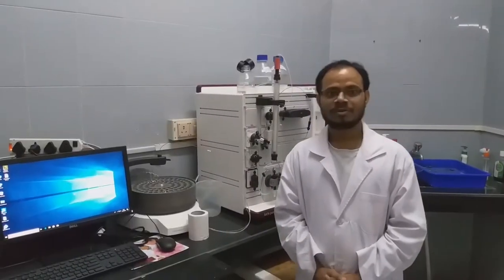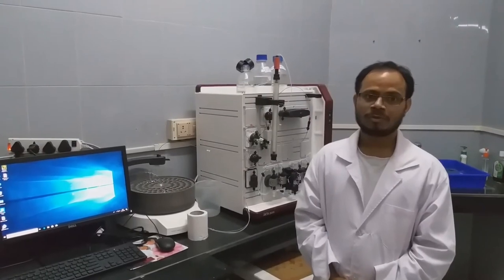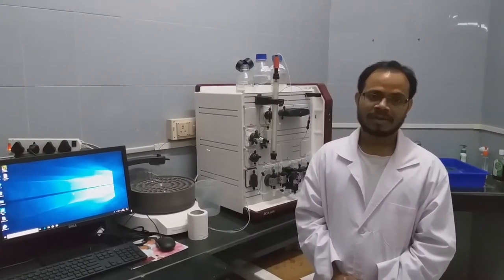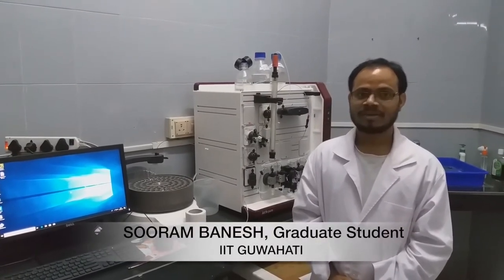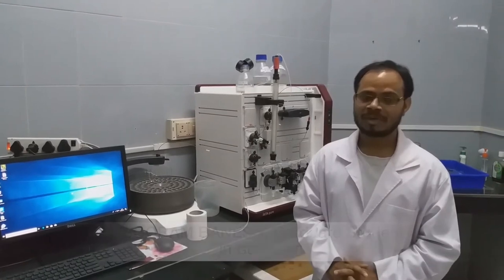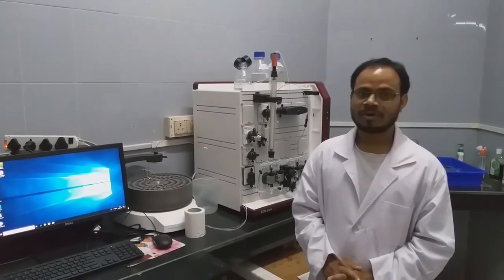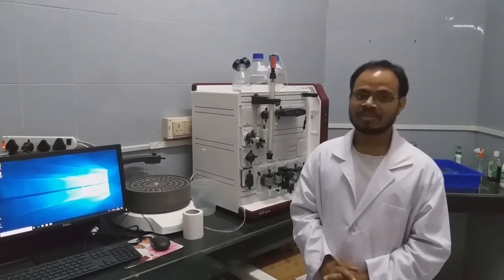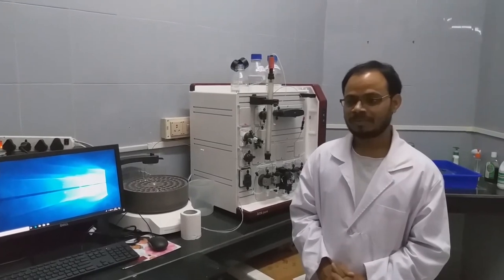In this video, we will show you how to operate an FPLC instrument and the basic principle and mechanism of separation of proteins using FPLC.